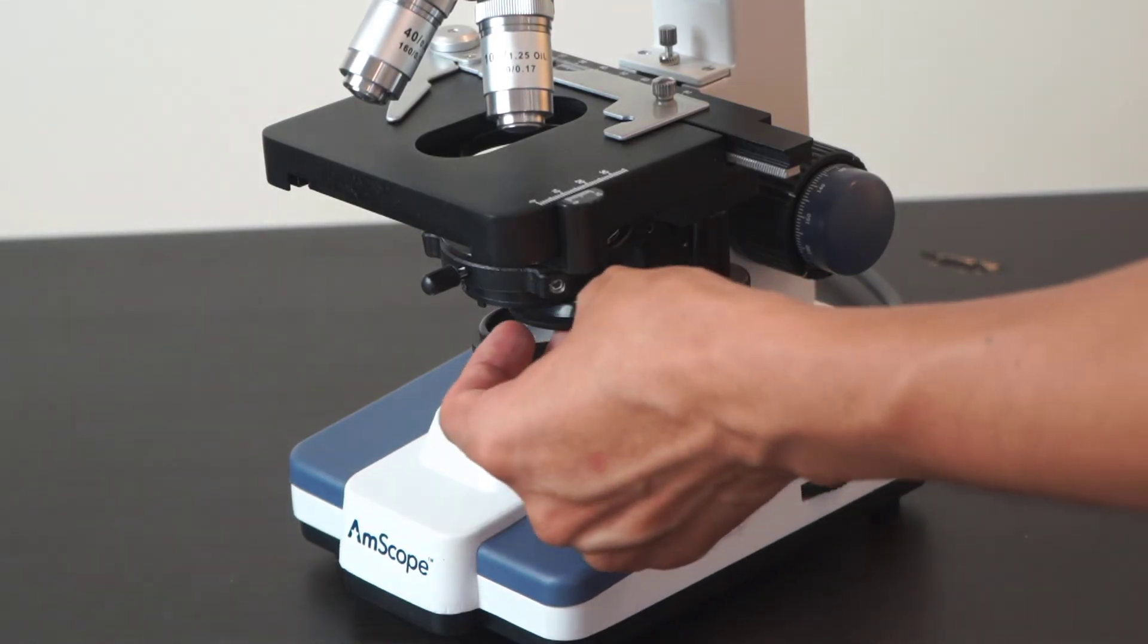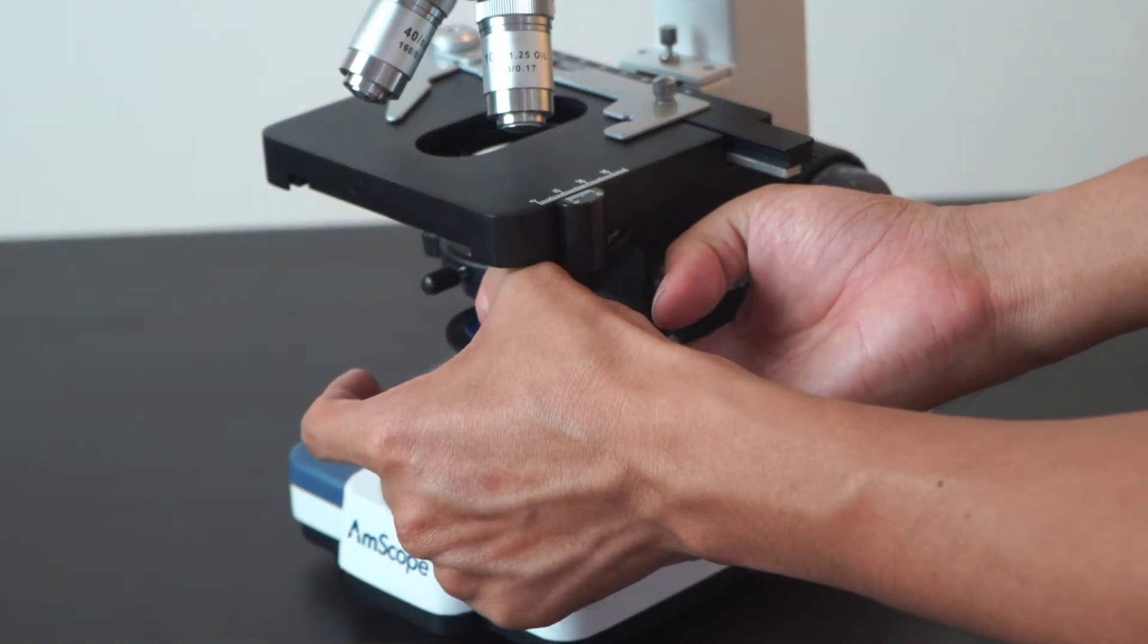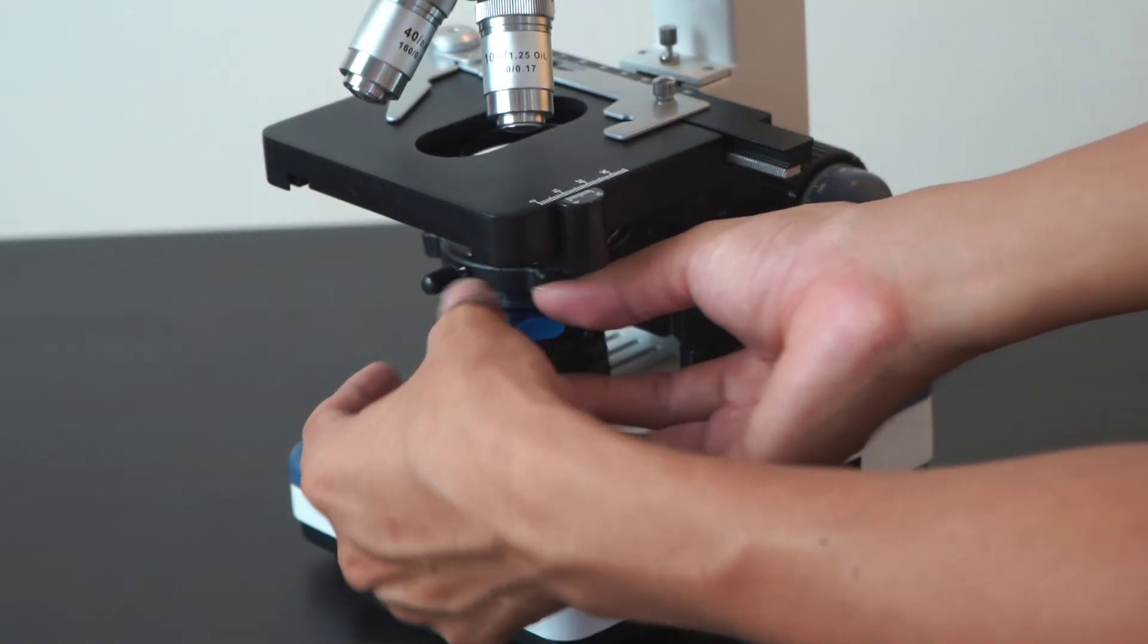To attach any filter, you can slide out the filter holder, insert your filter, and slide back in the filter holder.